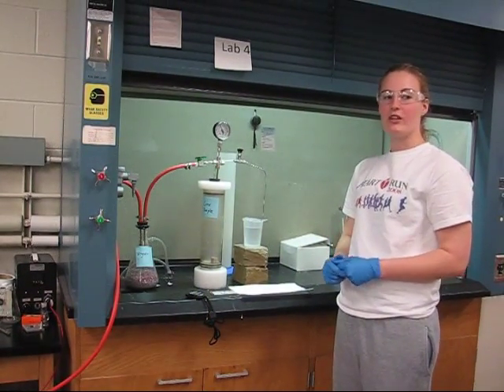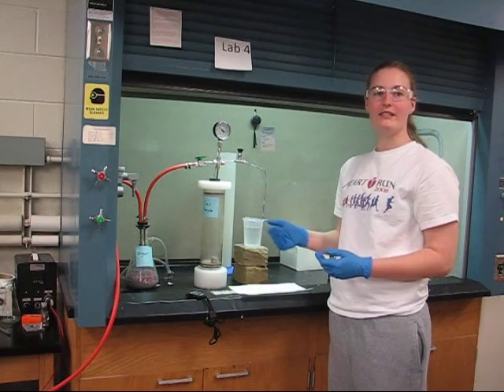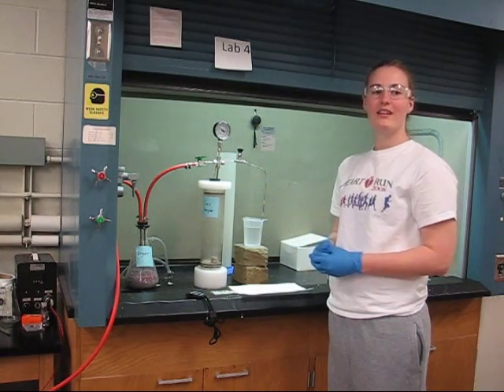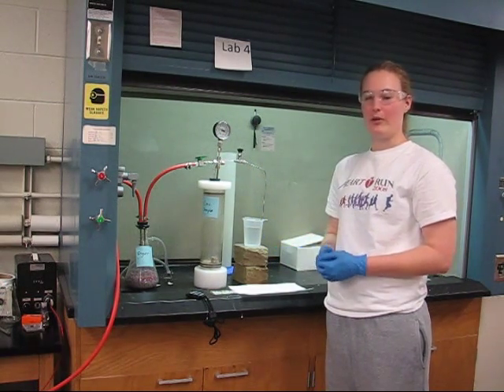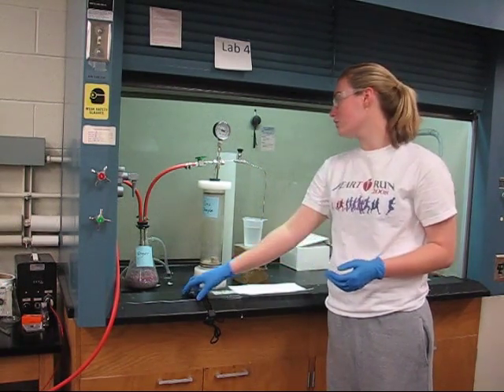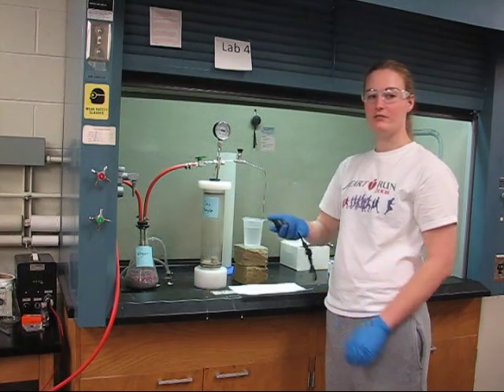The vacuum pressure dial will turn counterclockwise. When the vacuum pressure becomes stable, we're going to wait for two minutes and record this with our stopwatch.